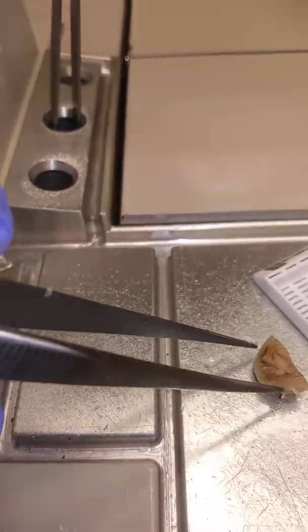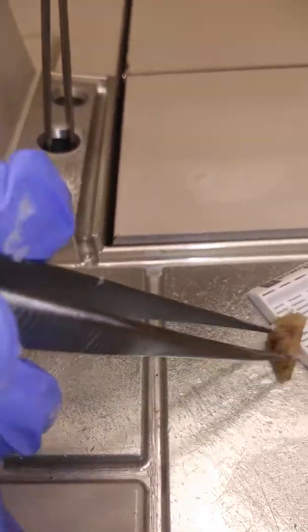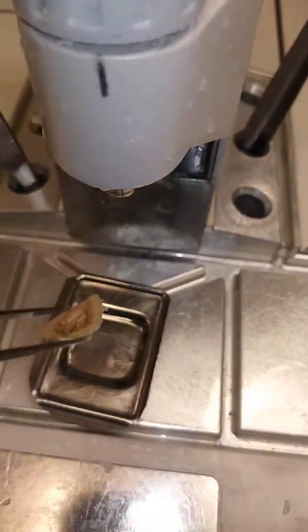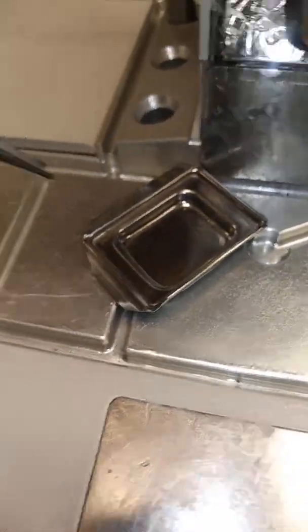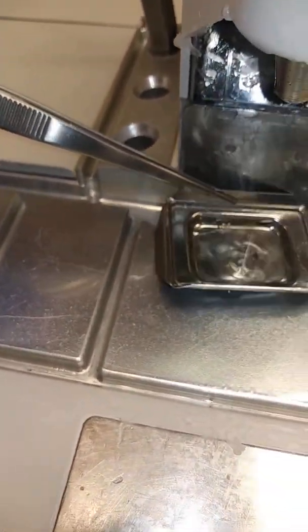Usually the way the tissue comes in the cassette — if it's calm, usually after the PA, if it's a good PA — if you see the tissue come like this and the cassette does the same way, come like this in the cassette the same way, you have to embed it. I had to change the mold because the mold was obviously too small; I have to get the next size larger.